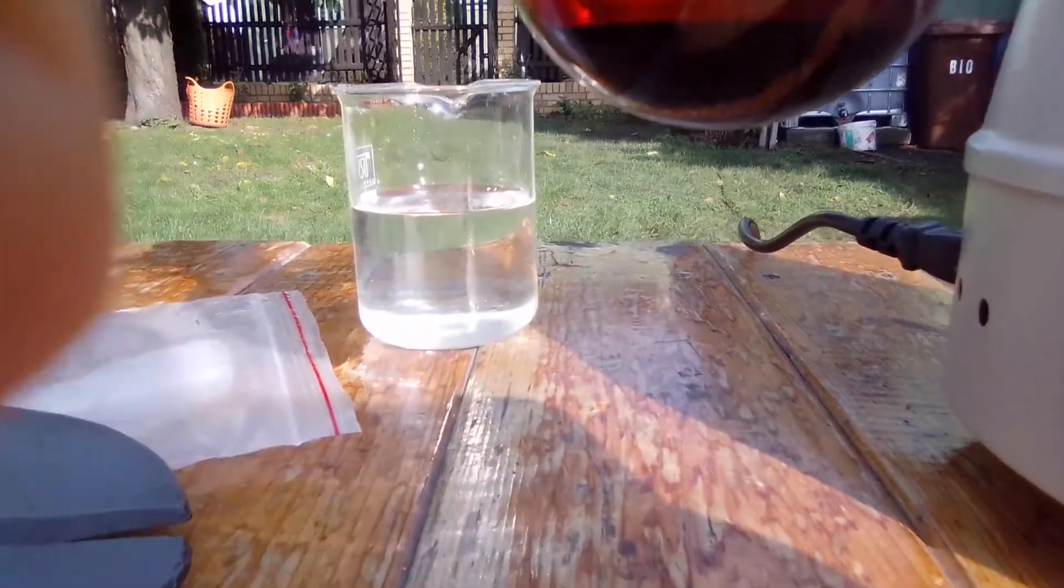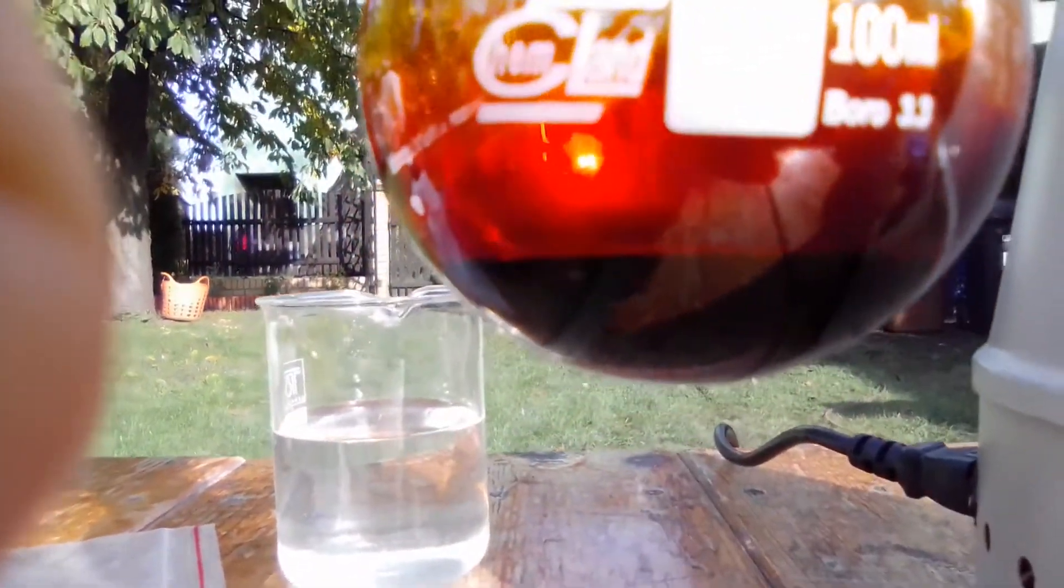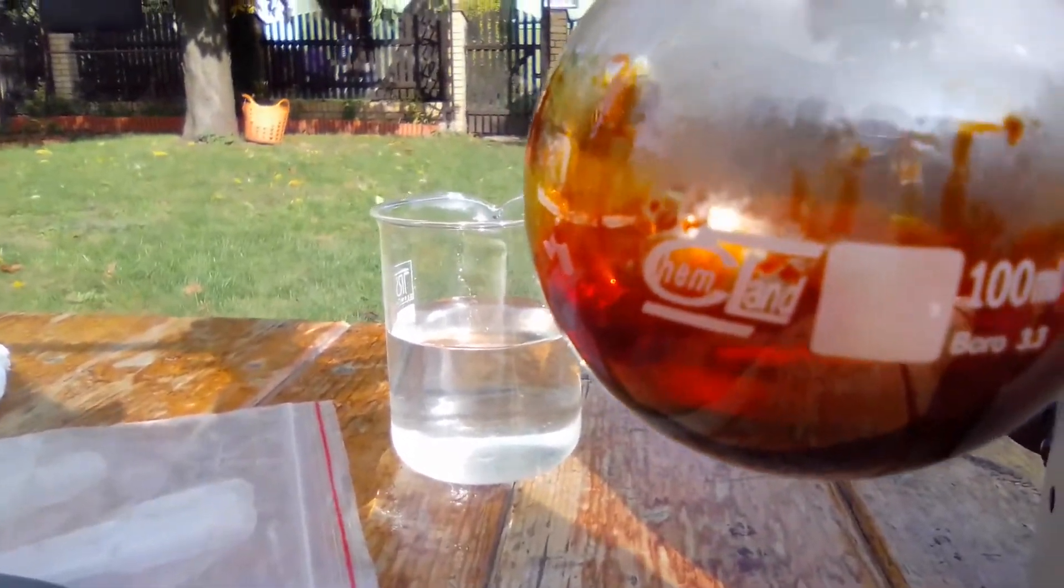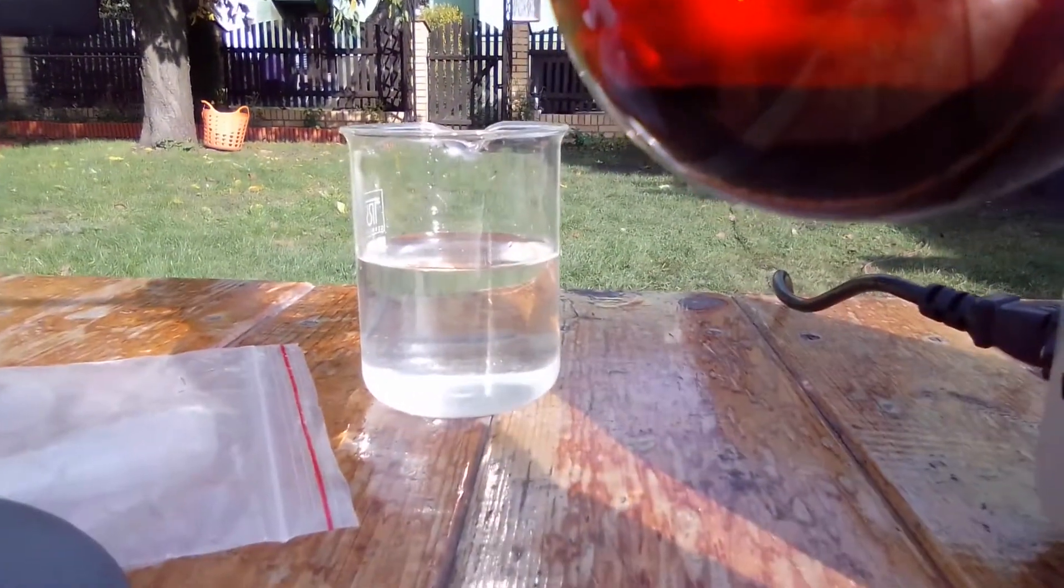I have decided to stop the reaction and as you can see there is quite a bit of tar on the bottom. This is presumably our dye mixed with some impurities.